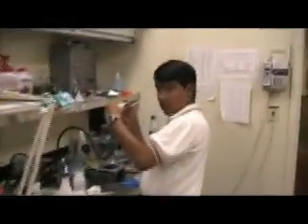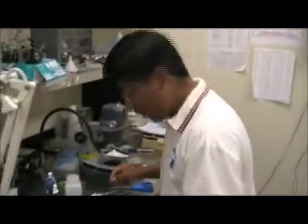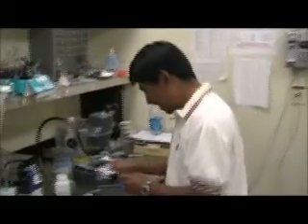This is Bastien, a PhD student from Namur. And here you have the computer which controls the microscope. You can see that an experiment is running at this moment. This side is where we are preparing the sample, and this guy here is Daniel. He is a postdoc at the beamline and he helped us a lot during our stay here at Berkeley.